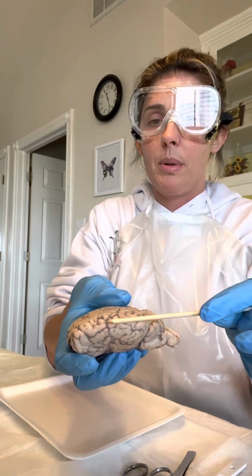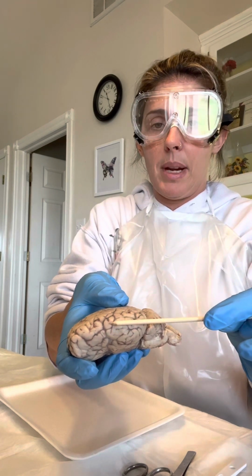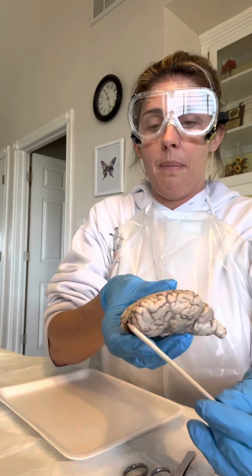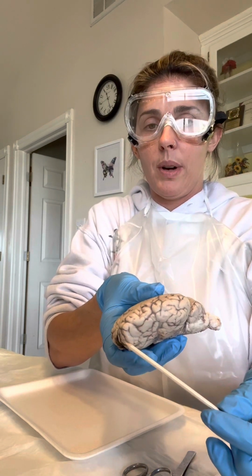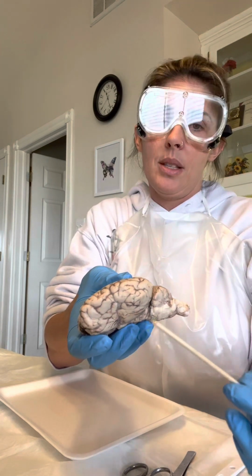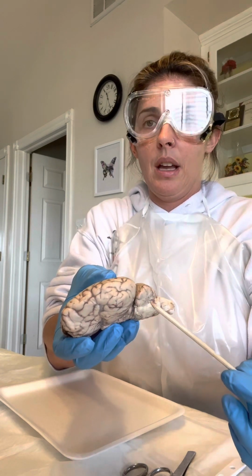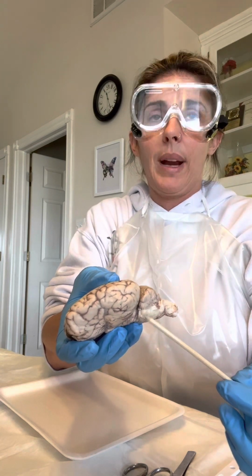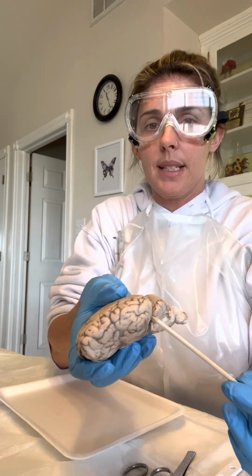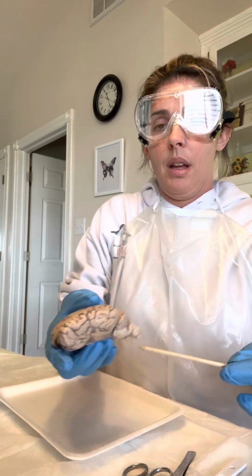Your parietal lobe up here on the top is for spatial relationships and sensory information. Like I said, back here is your vision, the occipital lobe. In the front, your frontal lobe is where you'll have personality and social behavior. And then the temporal lobe is where most of our function comes from. It is speech, hearing, recognition with vision, words, hearing certain words, just recognizing things. That's where a lot of our memory is.